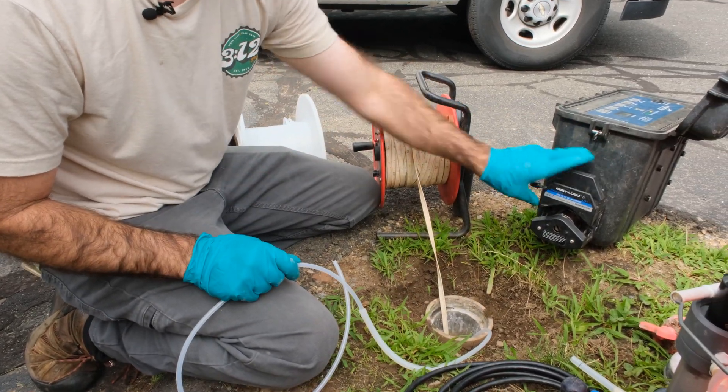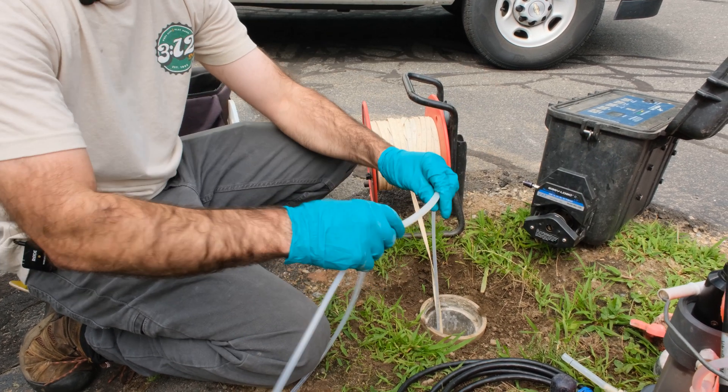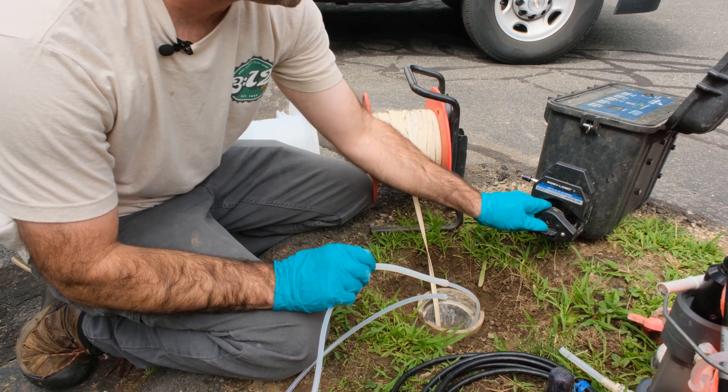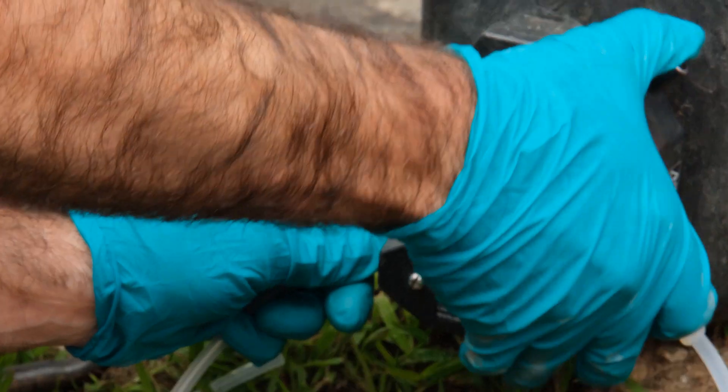This is our pump. You need to make sure your pump head is open and it has jaws underneath it. The soft tubing has to be squished by the jaws to create a seal, and the rollers are what pull the water up to grade. Put your tubing in and clamp down your head.